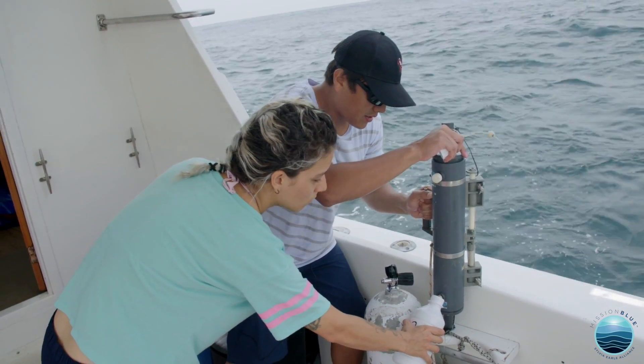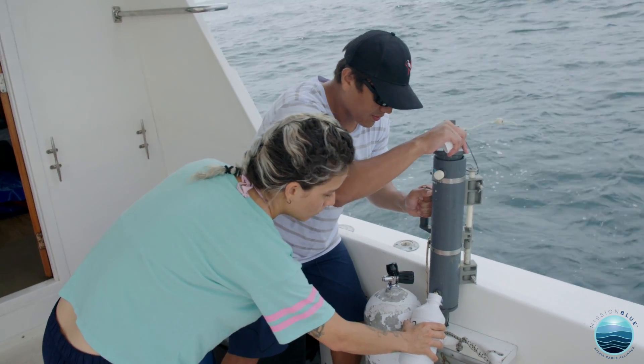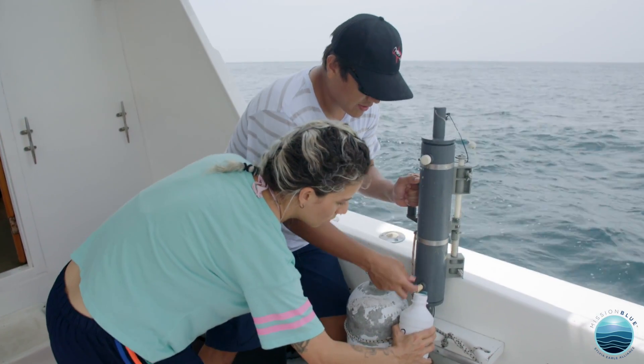And I just fill. This is approximately one liter, which should be good for the cell count and the identification.